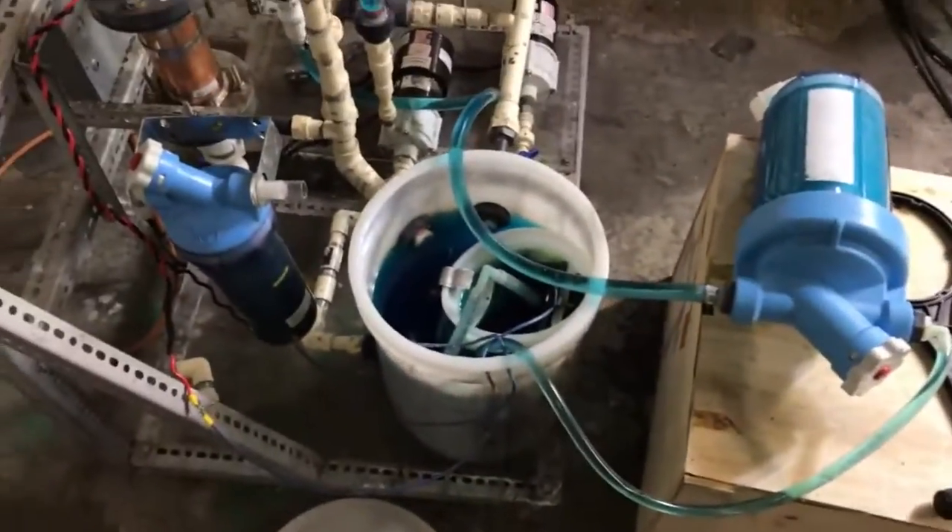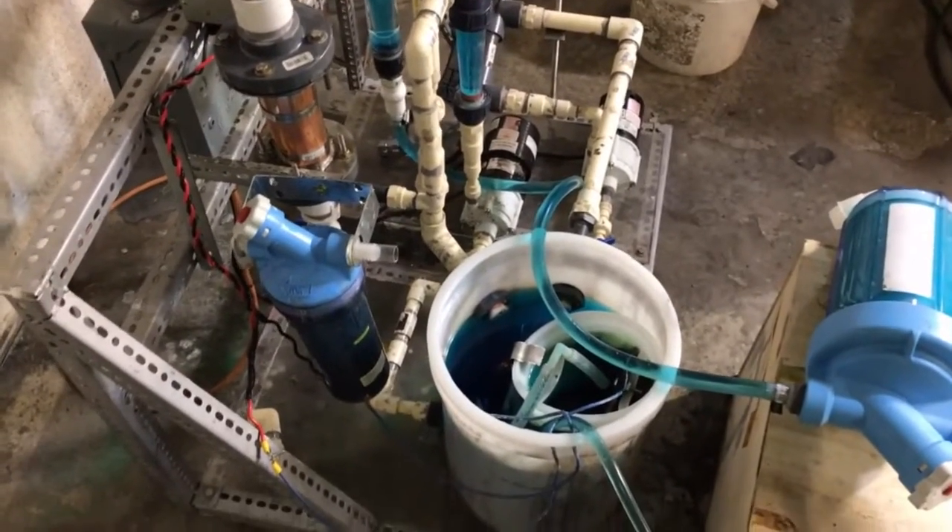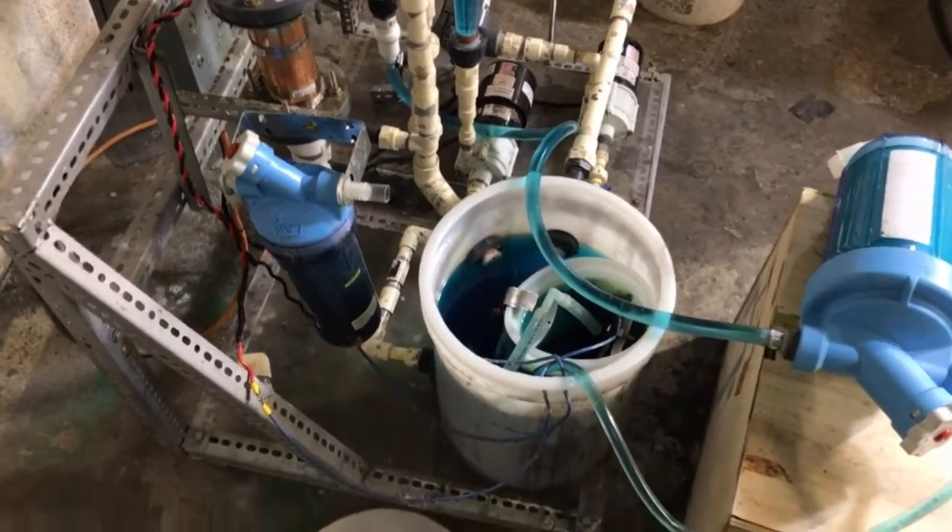I have also been adding copper sulfate occasionally — I put it in a small anode bag and just hang it over the side. At 160 hours in, it broke on me.